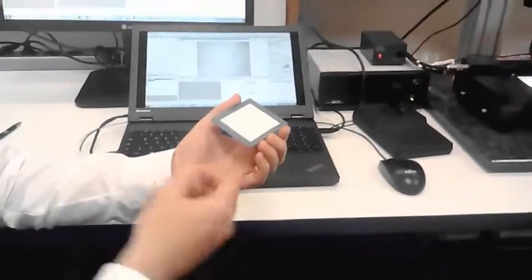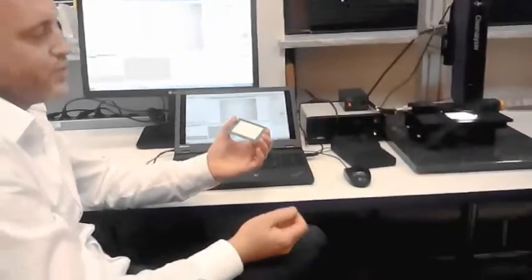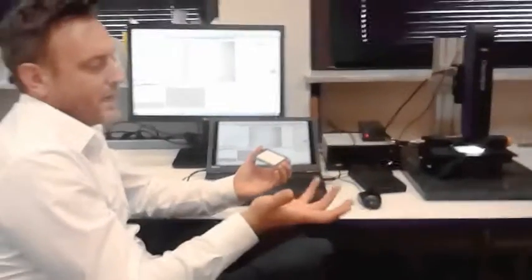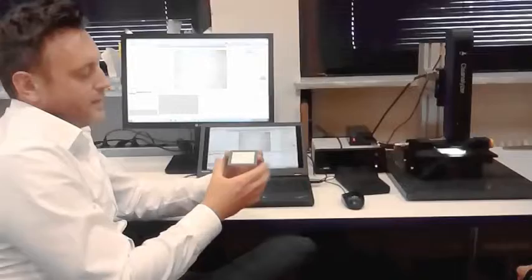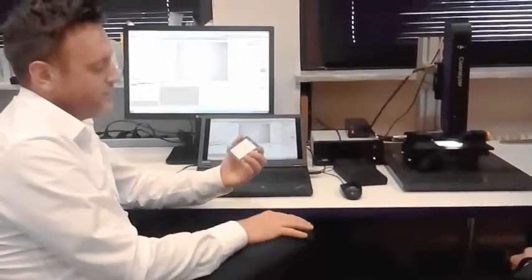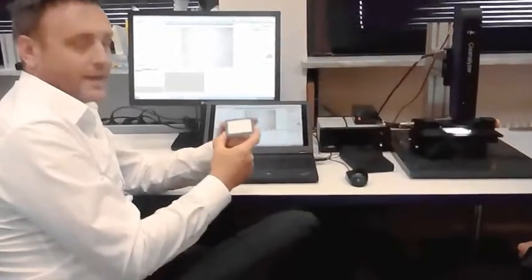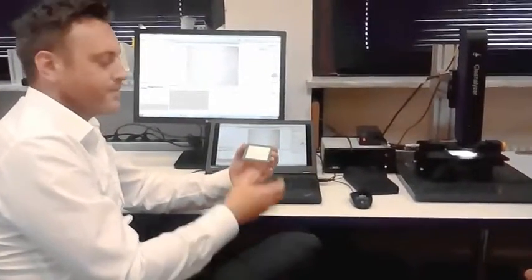So typically a manufacturer would take his part, he would wash it using a very specialised procedure, he would then drain that water through a filter paper such as this, and the residual dirt would be captured onto this filter paper, and we are then analysing this filter paper for all of the particles that are on here, both for size, for type, for concentration and numbers.